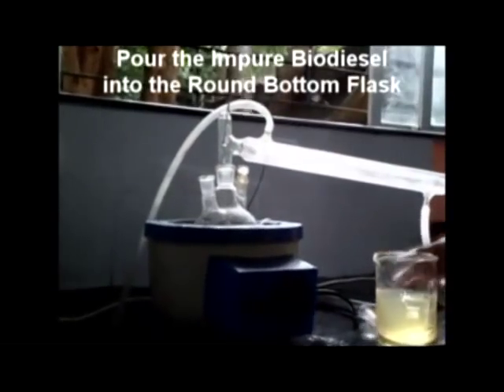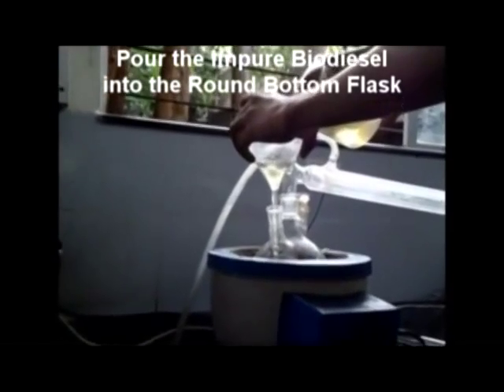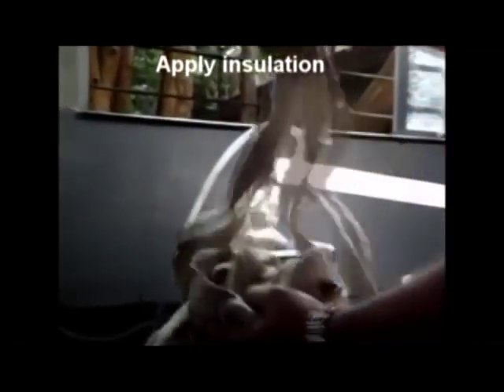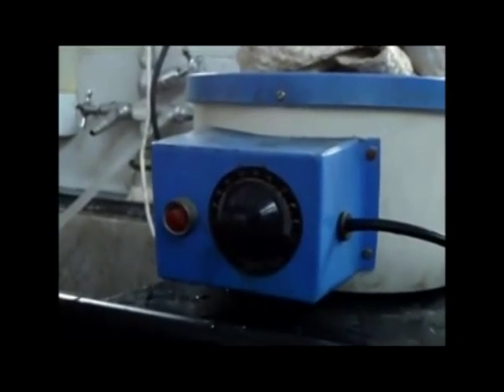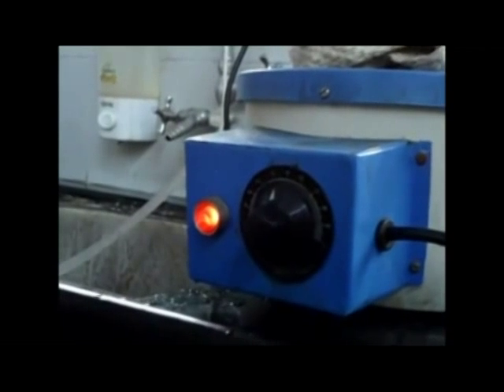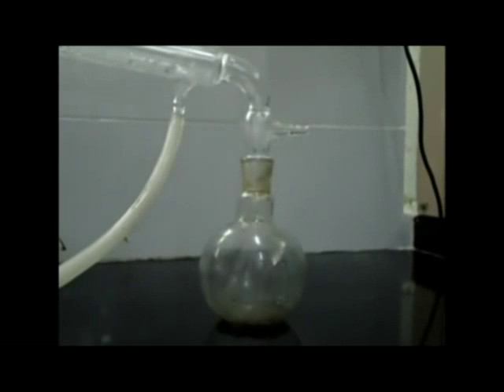For atmospheric distillation, pour the entire solution into the 3-mouth round-bottom flask attached to a horizontal condenser. A temperature sensor can be used to measure the temperature of the vapours. Remember to provide insulation around the apparatus to decrease heat loss. Set the heat duty to 40 units and switch on the heater, and remember to switch on the water supply to the condenser.